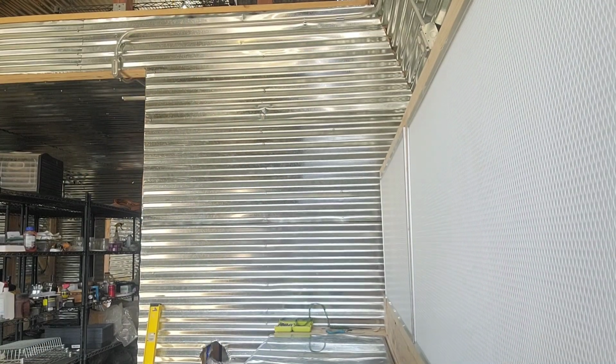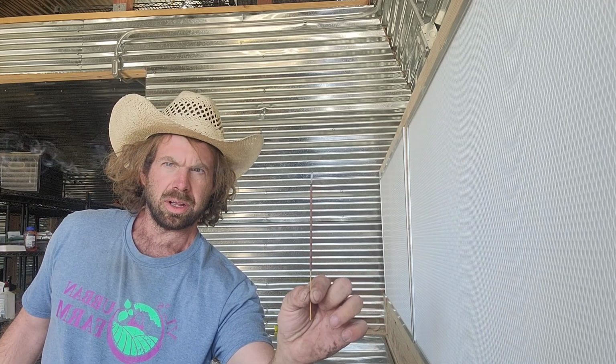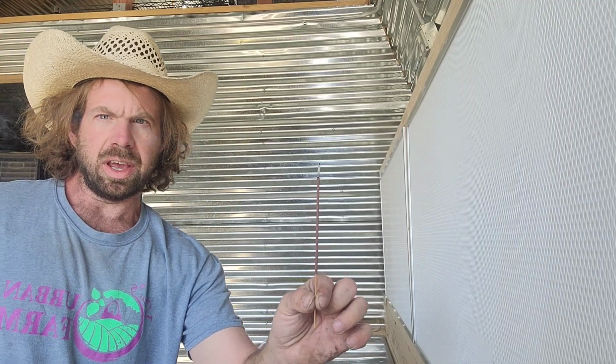Now, I have this incense stick I've got lit over here. It's kind of hard, I've noticed, to see the smoke on camera, but I'm just going to do my best, and we'll try a couple angles so that way you guys can see it. Okay. Incense stick. Hopefully, there we go. I feel like the camera's picking it up. But basically, you want to see this smoke blowing horizontally. All right, now I'm going to take this. I'm going to keep moving the camera around a little bit just so you guys can maybe see that.